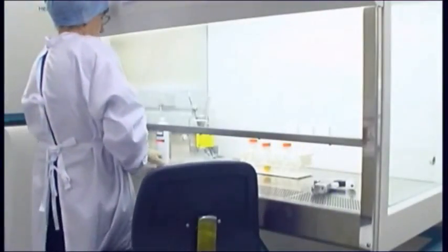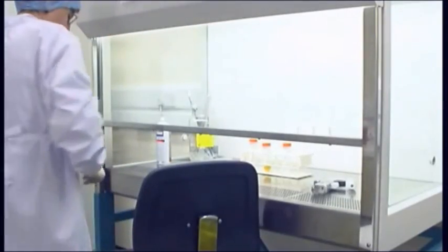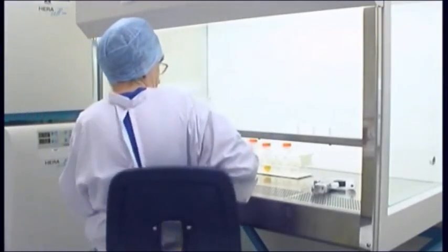After working in the cabinet, ensure that it is clean and free from all items that have been used in the procedure and ready for the next person to use.